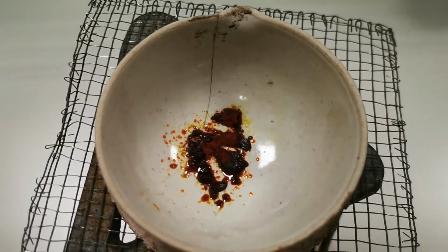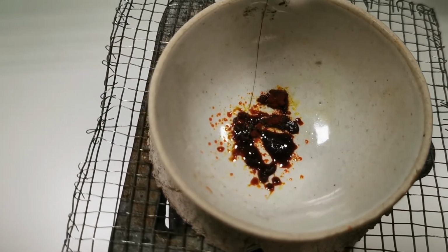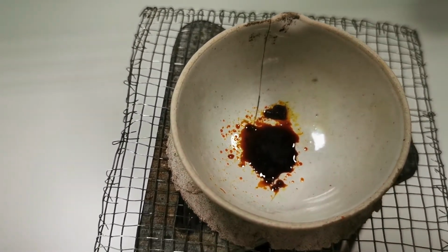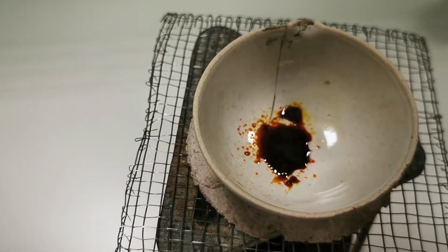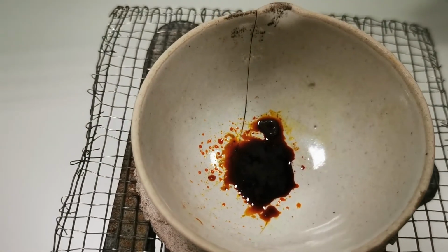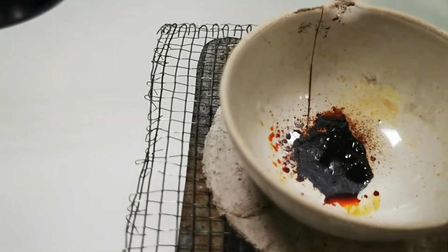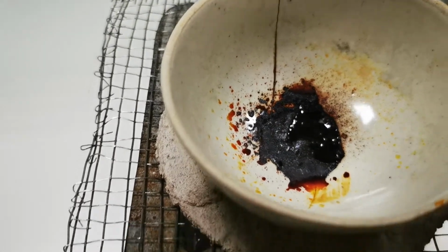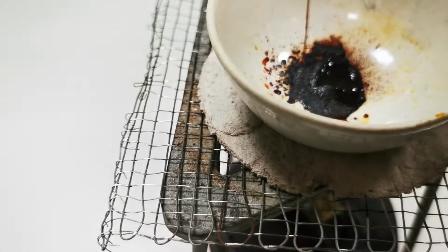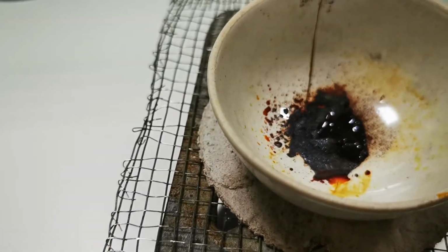So as you can see here, the first hydrate, we are heating it, and you can see clearly that the texture is changing because the molecules of water are evaporating in this hydrate. We have to keep heating it until all the water evaporates. So now again, after a while, you can see that I still have a few molecules of water, but the rest of the iron chloride hydrate already evaporated.